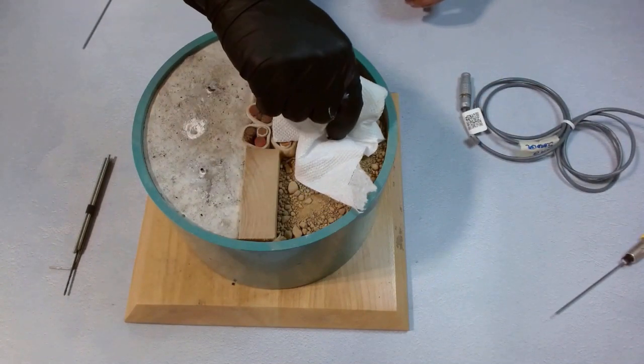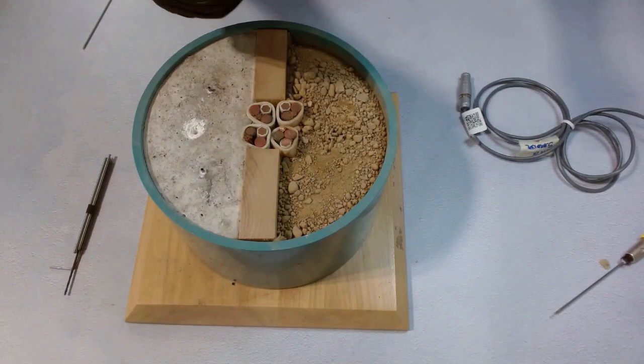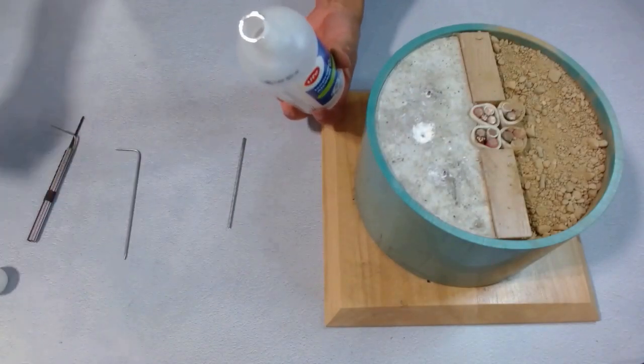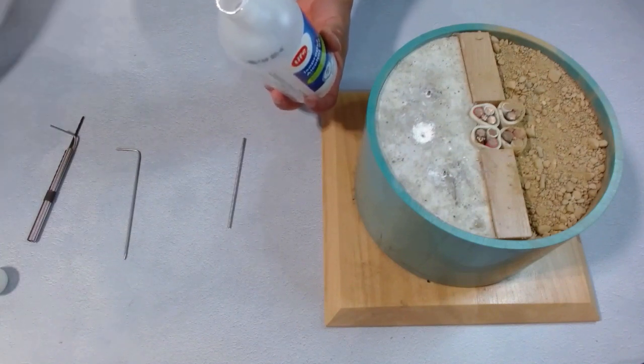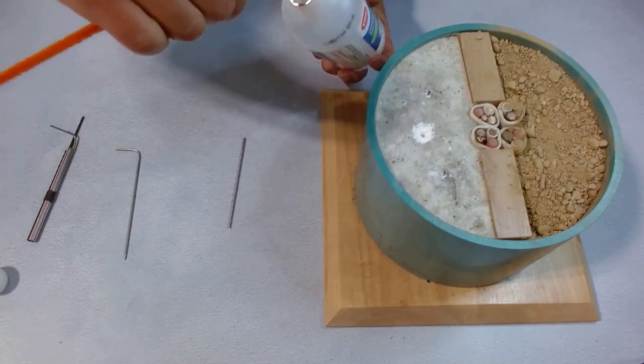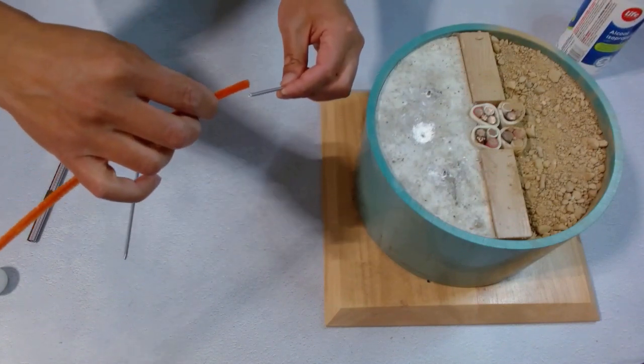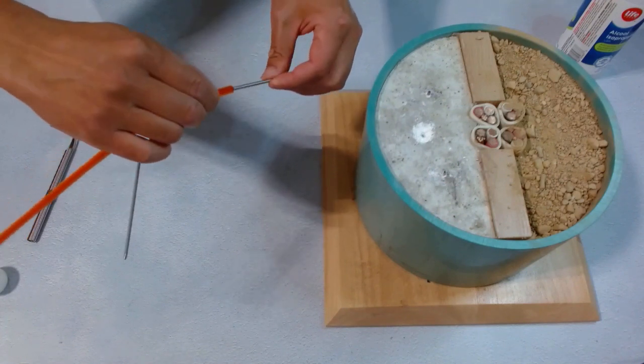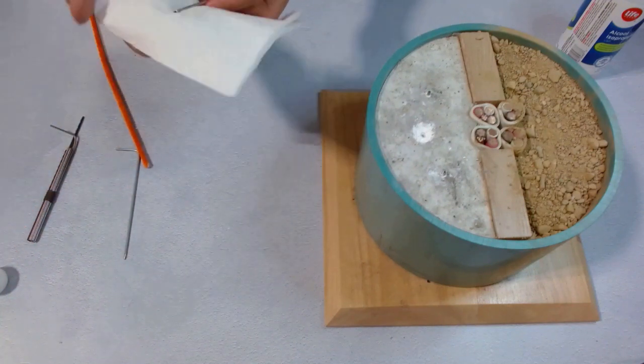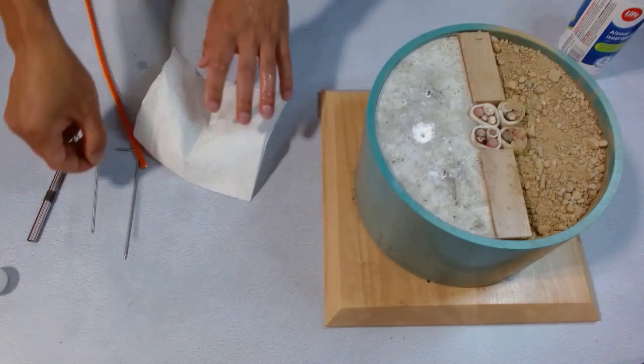The needle is cleaned. We also need to take this sleeve out and clean it inside and out. We grab the alcohol and a piece of pipe cleaner, dip it into the alcohol. We grab the needle sleeve and push the pipe cleaner into it. Push it in and out while twisting the needle sleeve to get all the thermal paste out. Now we wipe it dry. This needle sleeve is pretty clean now. We're ready to use it again.